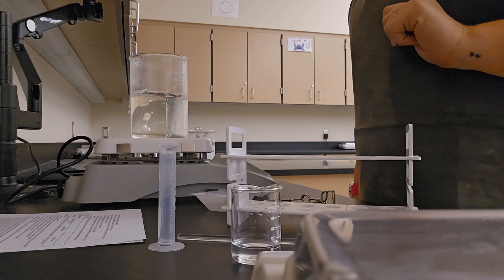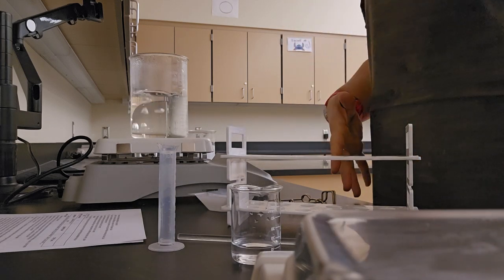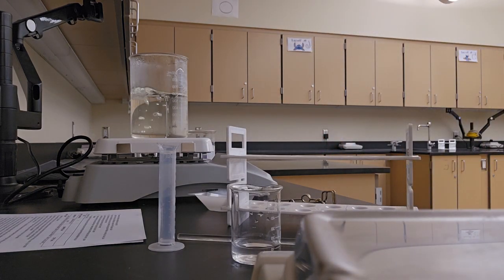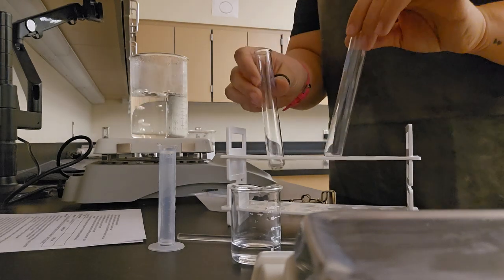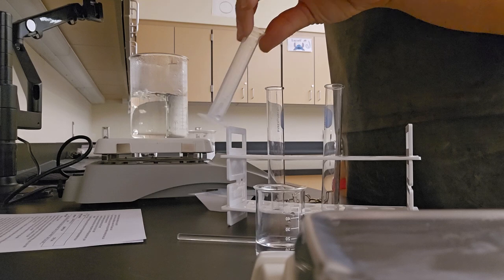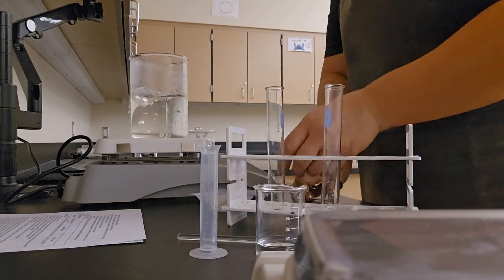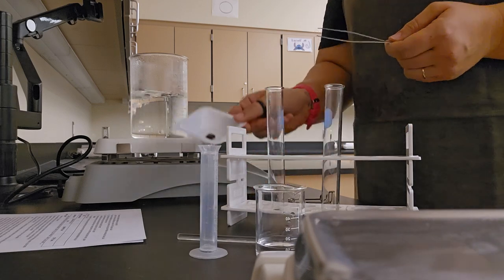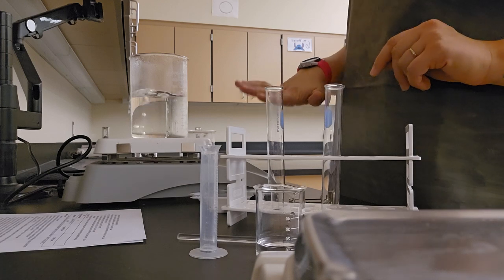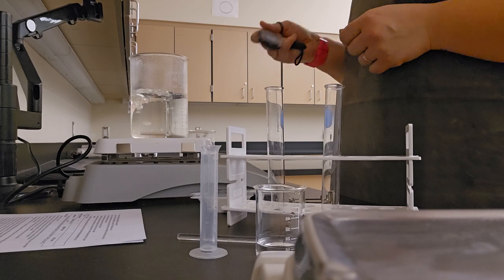All right, part C is all about temperature. I'm still dressed for lab. I have collected my new supplies. I have my 2 test tubes in my test tube rack. I have my hydrogen peroxide, my 10 milliliter cylinder, my test tube holder, my forceps and my 2 liver samples. And I have my hot water bath that I'm going to be very careful not to touch, and my cold water bath and my stopwatch.